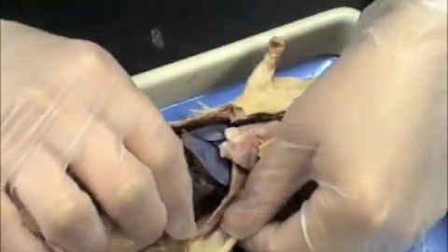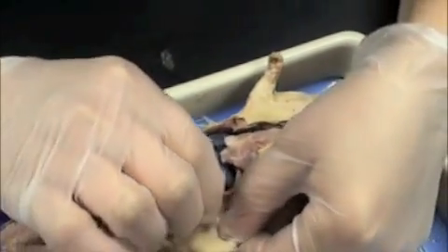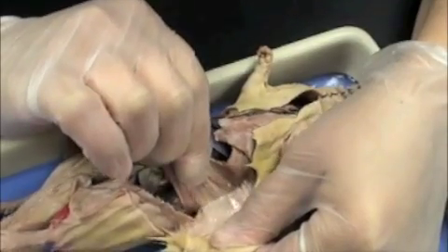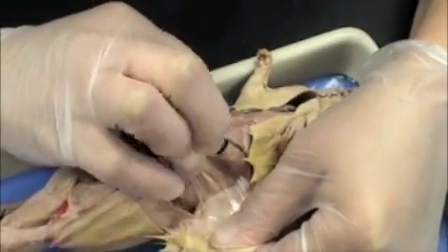This is the rat. If we tear apart the skin and the muscle, you can see that you're tearing the fascia. The fascia holds the skin and the muscle together.